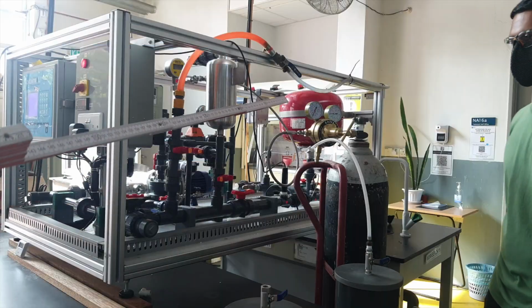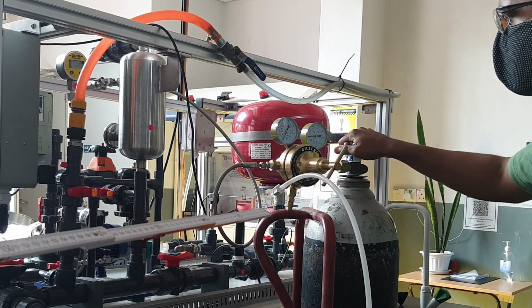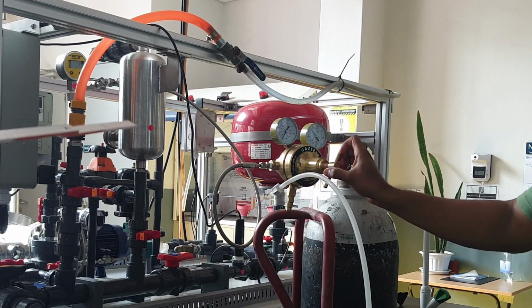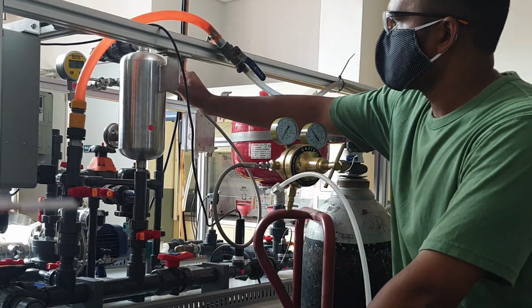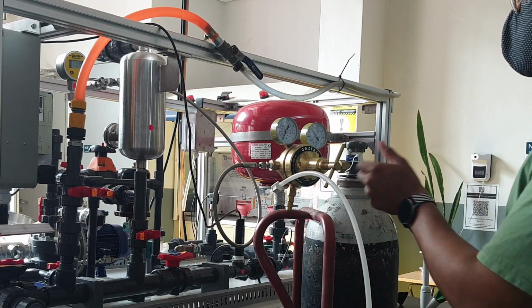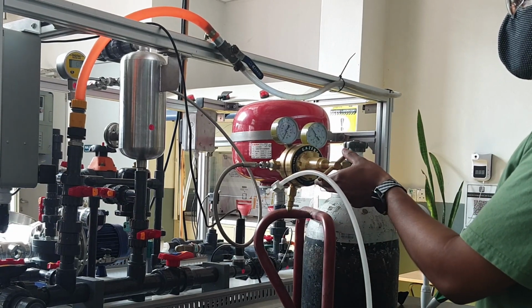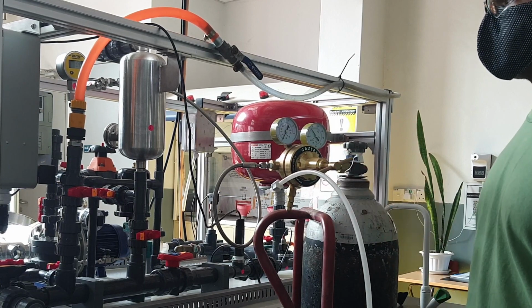So in this section, Aprav is putting CO2 into the dosing bottle. He opens the bottle, sets the regulator, and flushes the bottle with CO2 through to drain, so it blows through to drain at the bottom. This puts 2 litres or 4 grams of CO2 into the system.